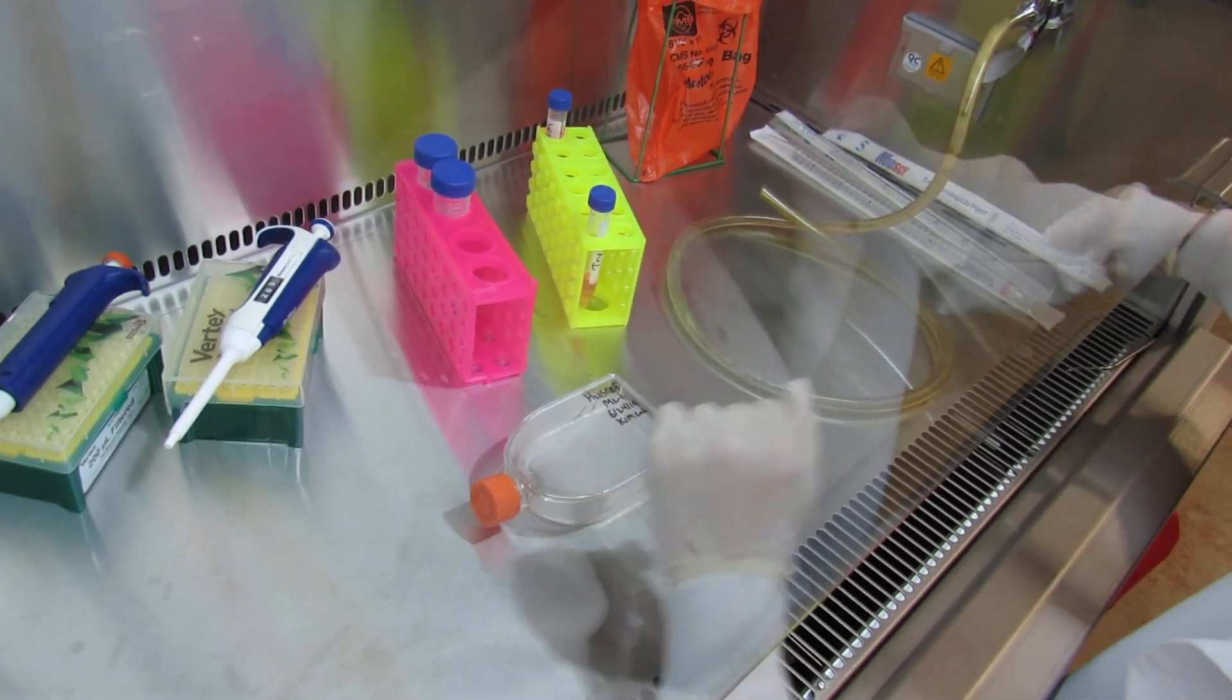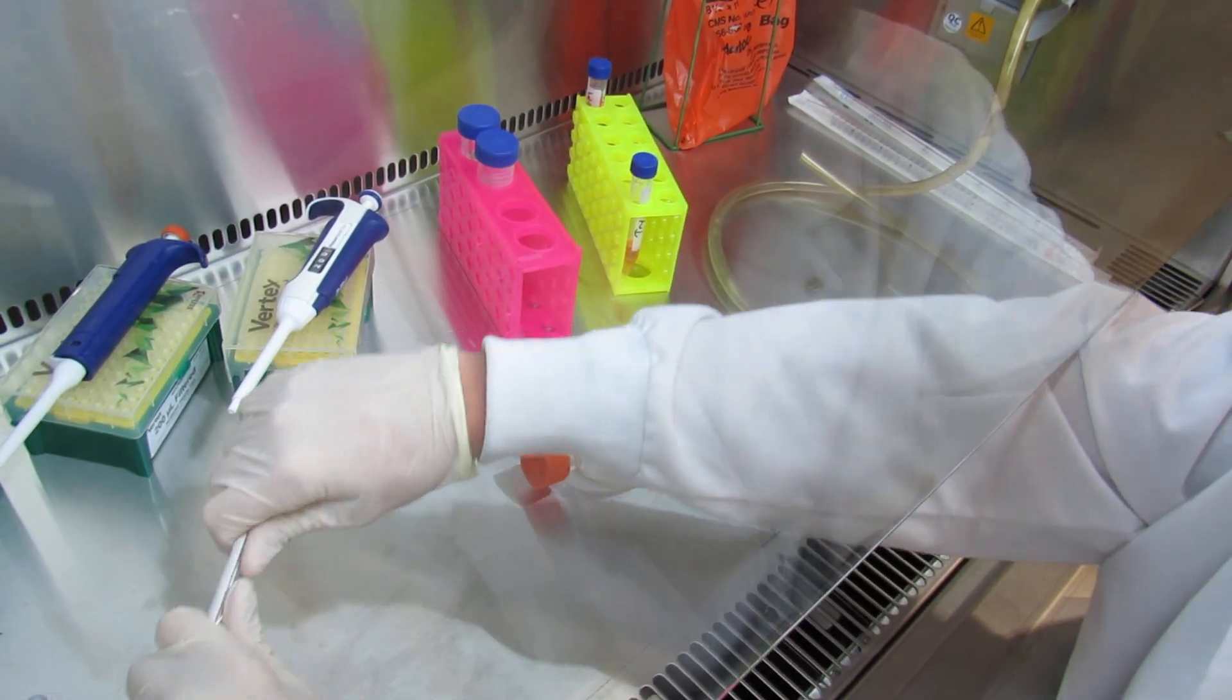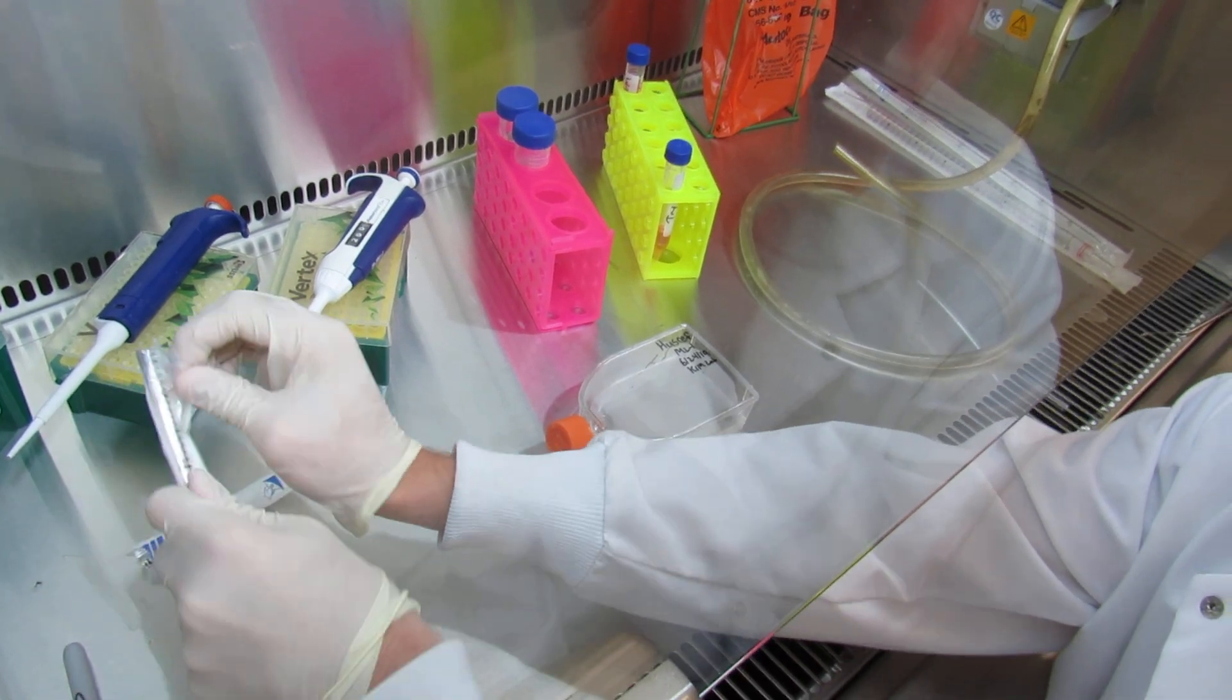So again, we will break our serological pipette tip like that.